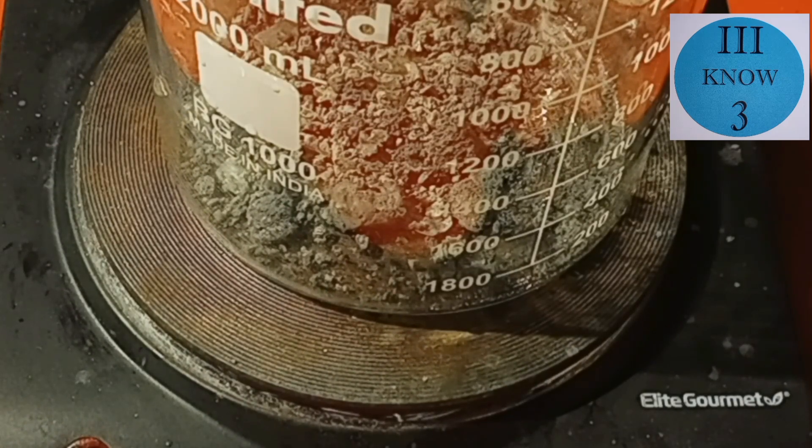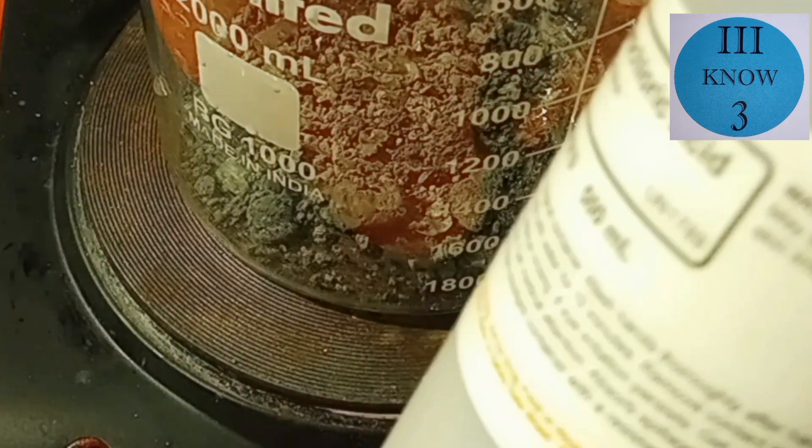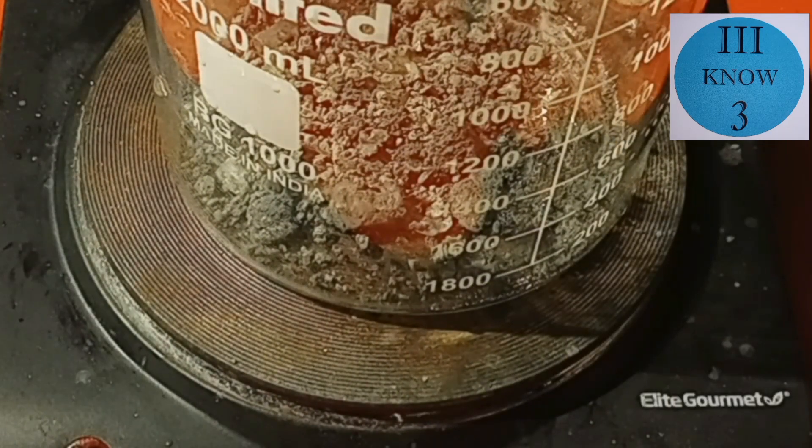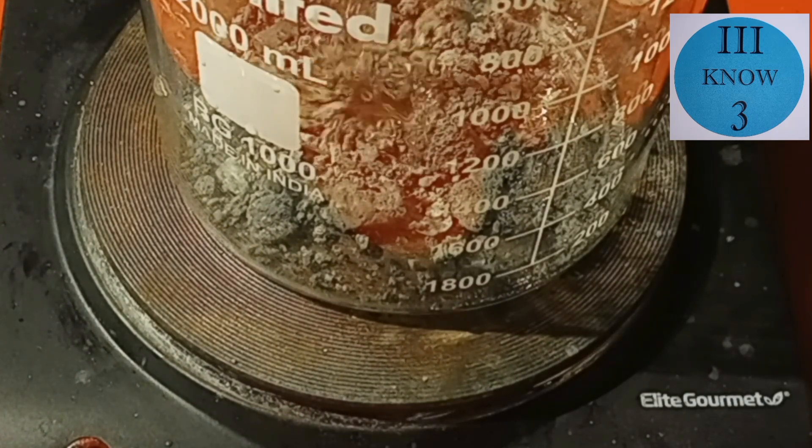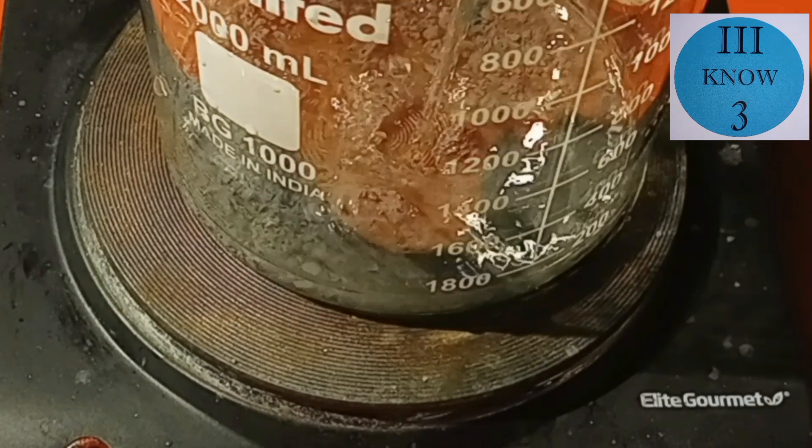So in the beaker here, we're going to add about 100 milliliters of this 2 molar technical grade hydrochloric acid. It's actually the last of this bottle.